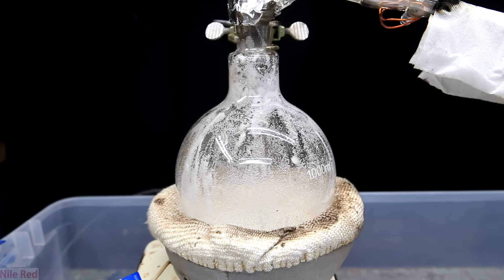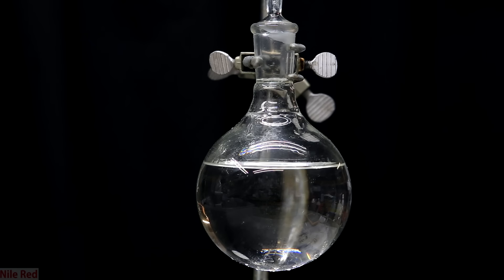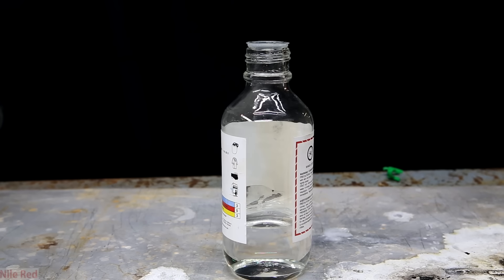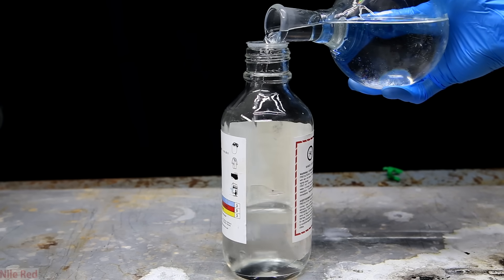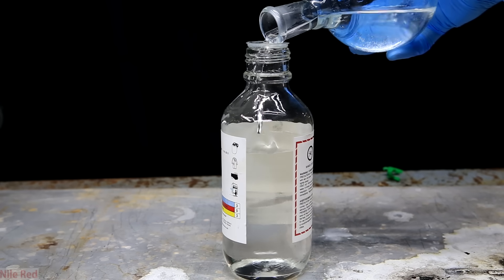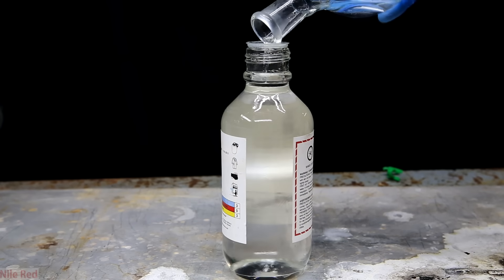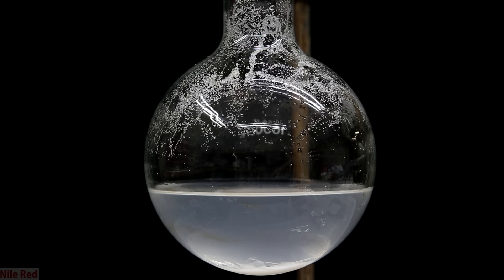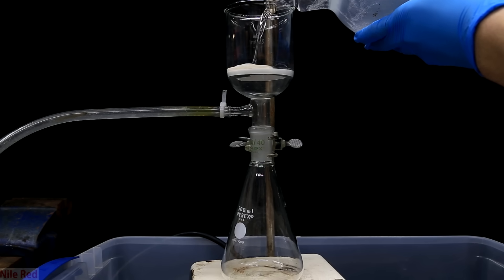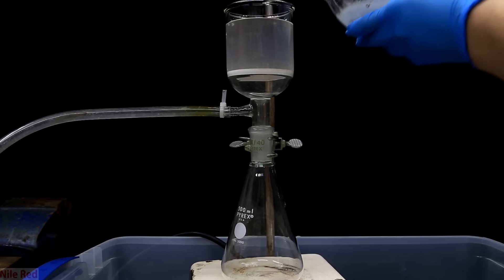We keep going with the distillation until there's not much left in the flask, then turn everything off and let the apparatus cool down. The receiving flask is removed and stoppered — we have quite a bit of nice, crystal-clear sulfuric acid. I pour it in directly and replenish my old stock. When it's added, you can actually see a density difference between the acid I'm adding and the acid that was already there — the previous stock was store-bought at around 95%, so my distilled acid is actually a higher concentration. In another batch there was a little sand in the product, so I filtered it, but my filter wasn't clean and it turned the sulfuric acid yellow.